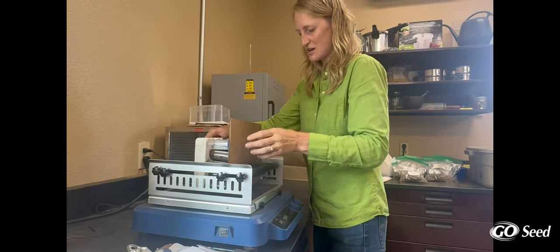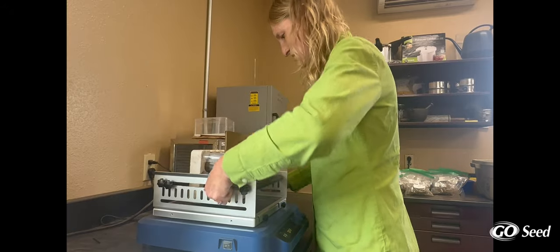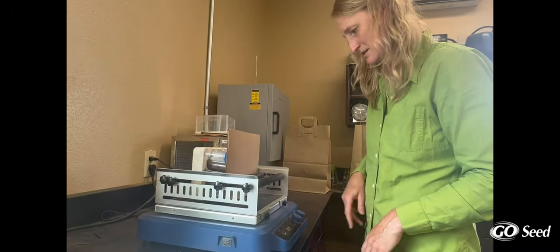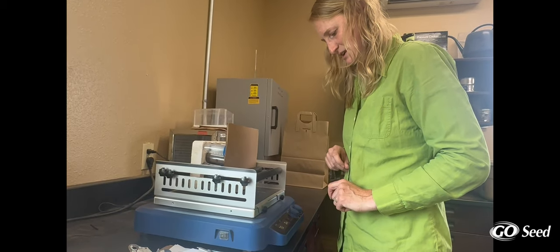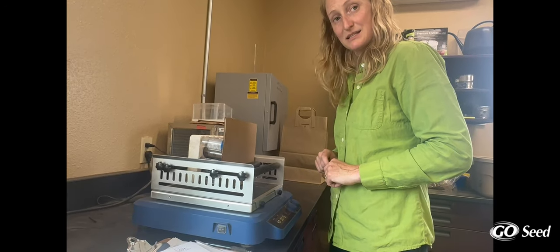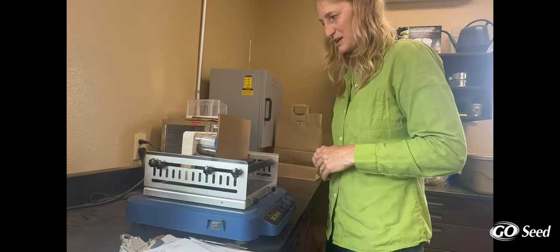Putting them on the shaker sideways so the soil doesn't just sit on the bottom of the shaker. I've got a handy timer that I can set to a specific speed and time. I've got it set for 15 minutes at 300 RPMs. It's ramping up to speed here.